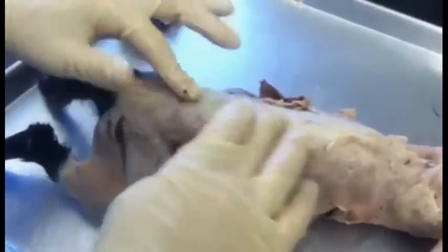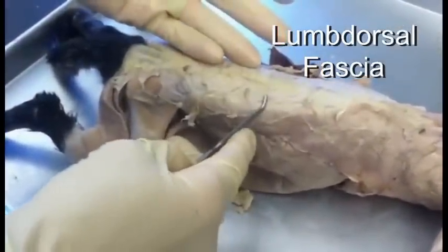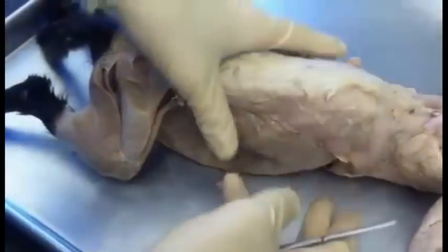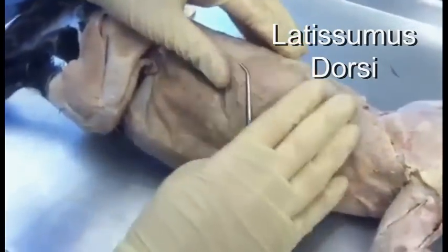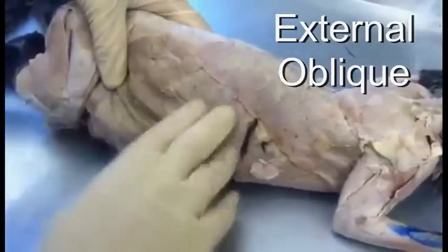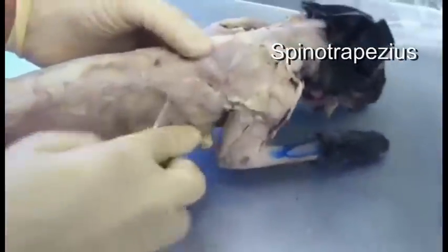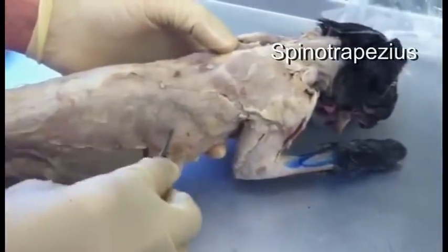Looking at the back, this is where the lumbar vertebrae are. This white fascia here is the lumbar dorsal fascia — dorsal side where the lumbar vertebrae are. This big muscle here is the latissimus dorsi, on the lateral dorsal side. Then you have the external oblique, another big sheet muscle. Going towards the head, there's a line that separates the latissimus dorsi from the spinotrapezius.